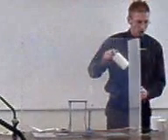If you've had too much water, you won't get a good reaction. I've got three lots of test tubes.